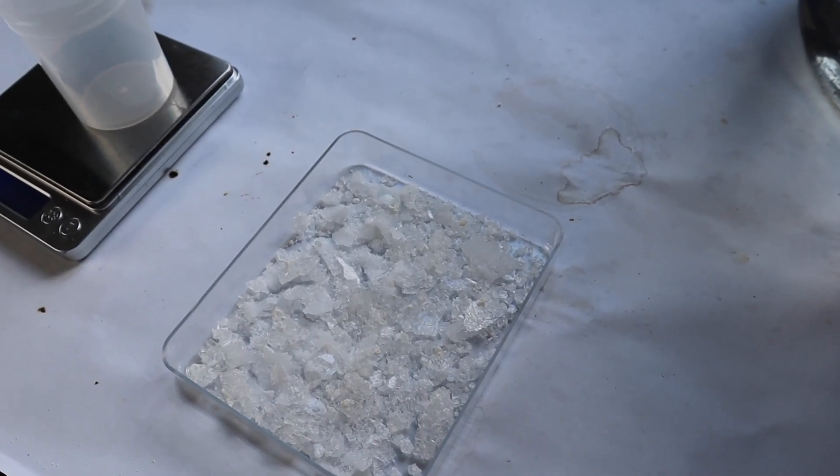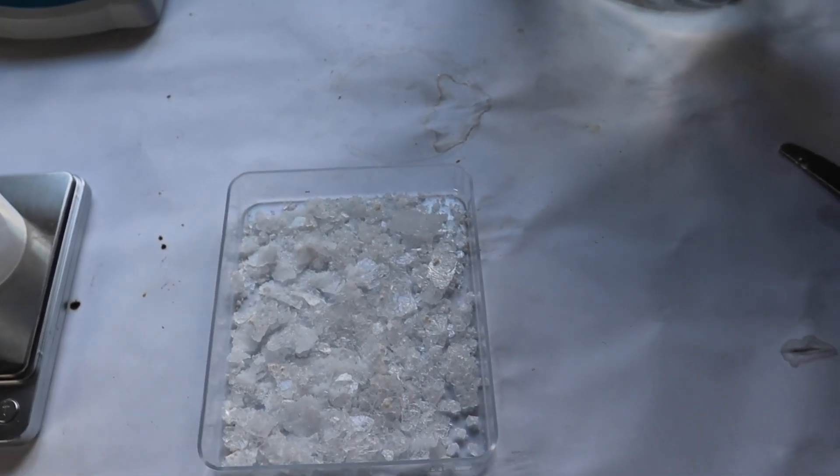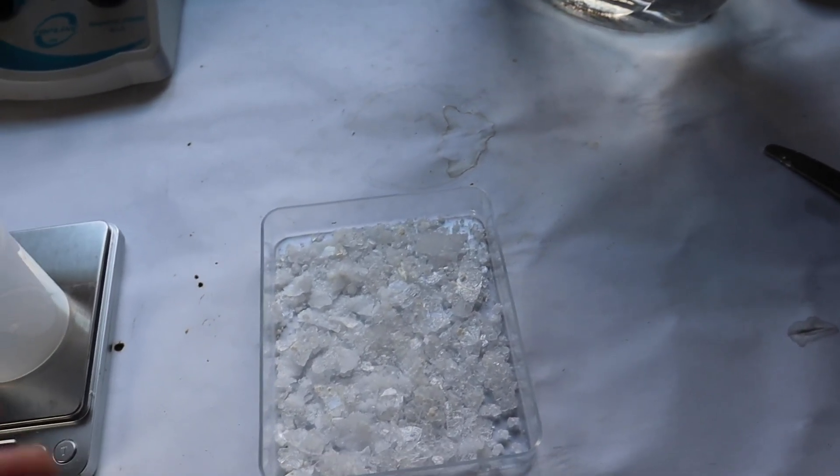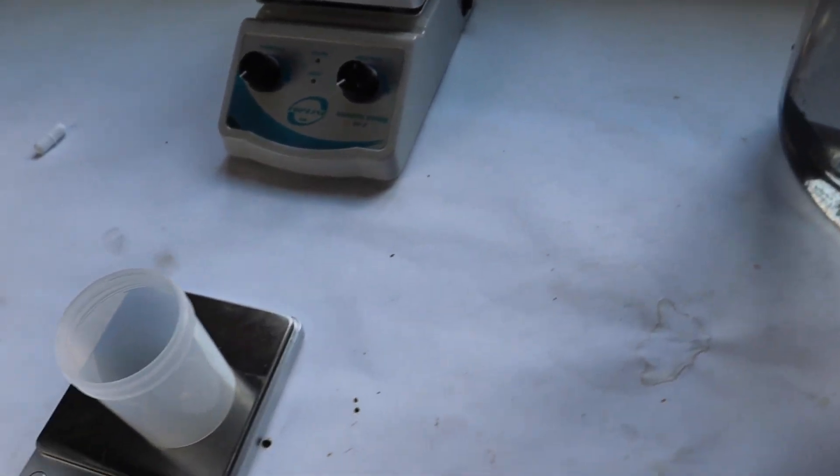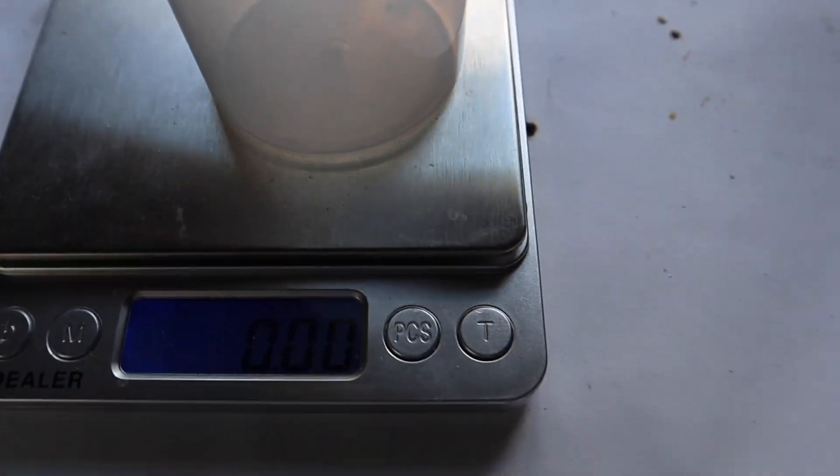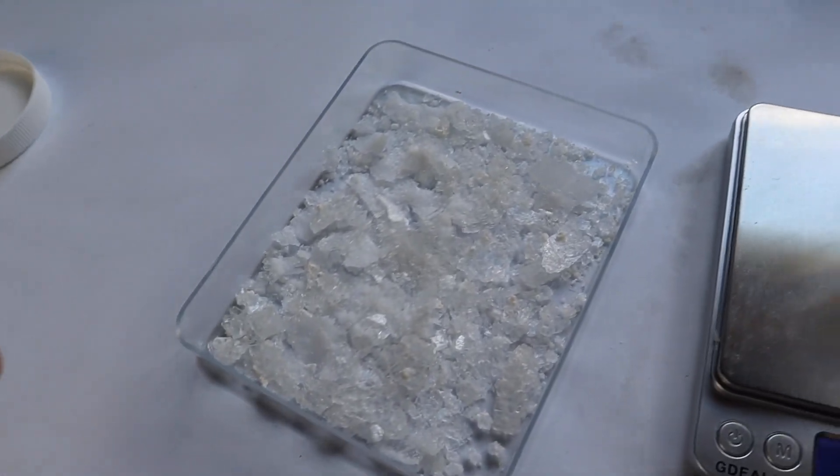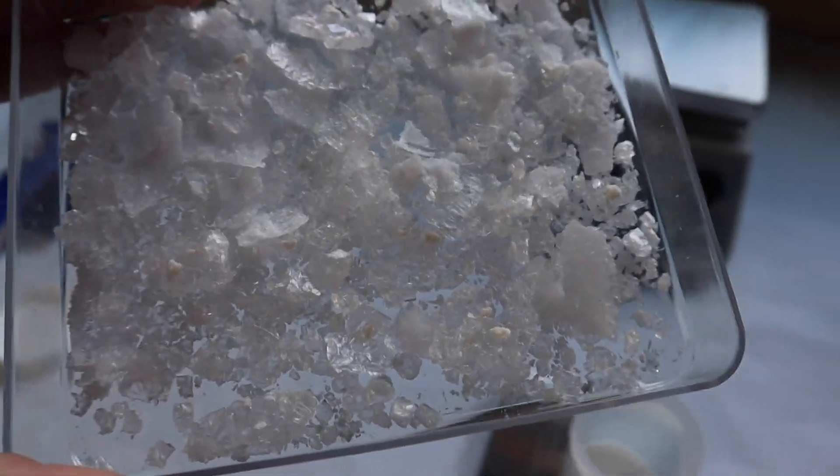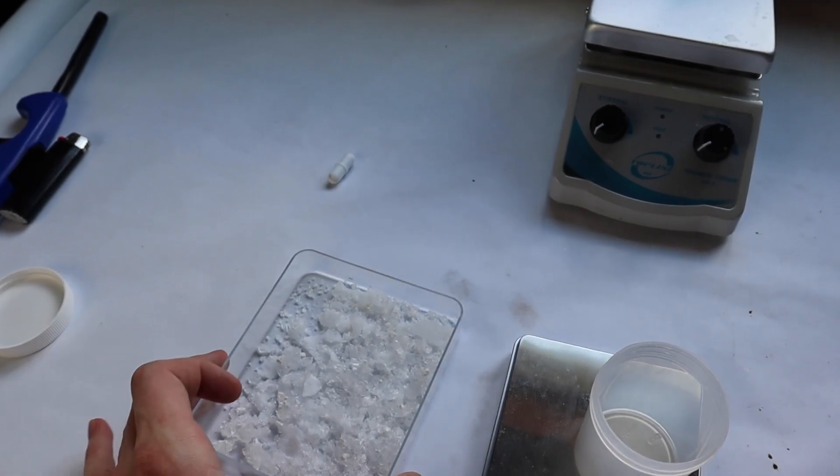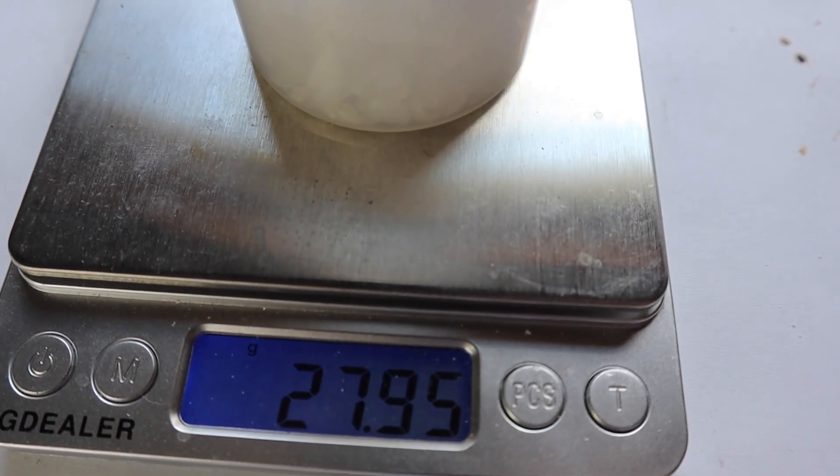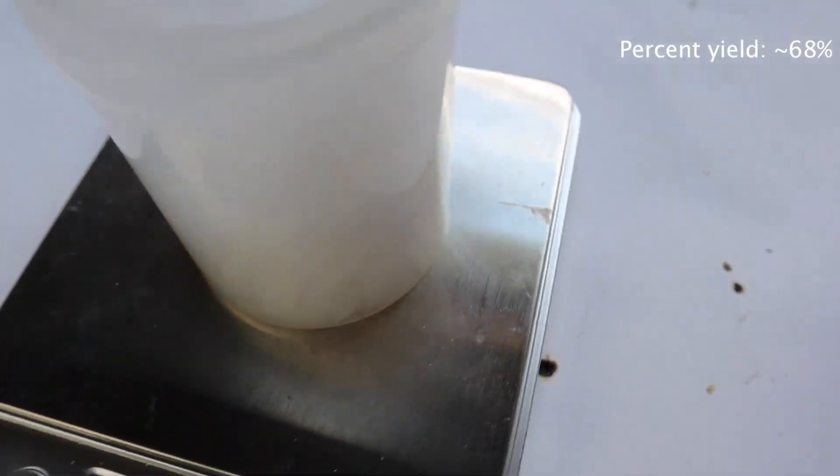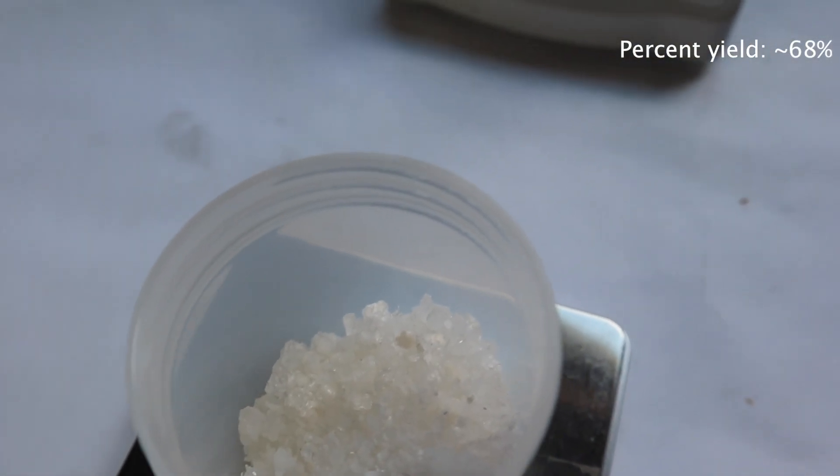I definitely spilled a little bit of it, probably like 7 grams worth. I'm not sure, but I'm just going to transfer it to this little container and we're going to see what our yield is. So we wanted 41 grams. This definitely is not 41 grams, but maybe we got a nice 20. It looks like I got about 30 grams. Considering I spilled some, I'm definitely satisfied with that.